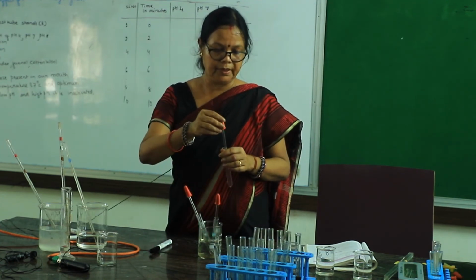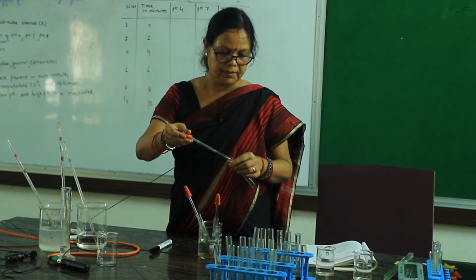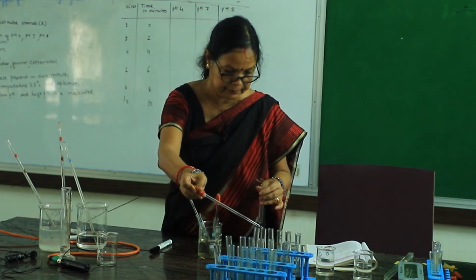So after the 2 minute interval, add solution from pH 8 to the second test tube of the set.